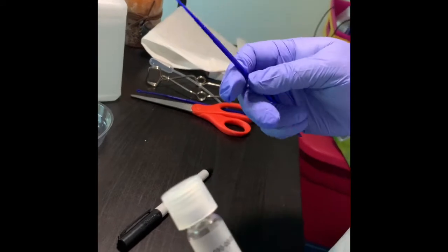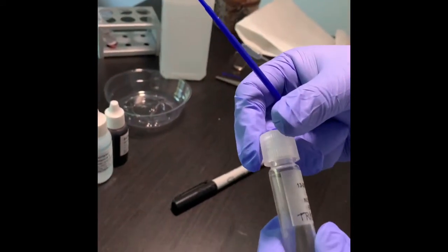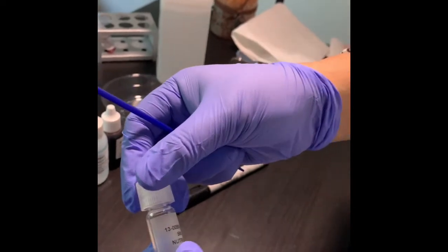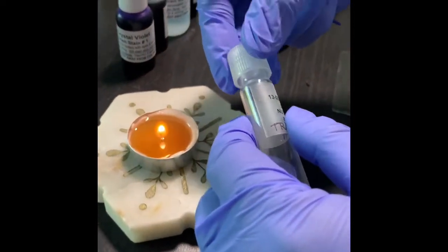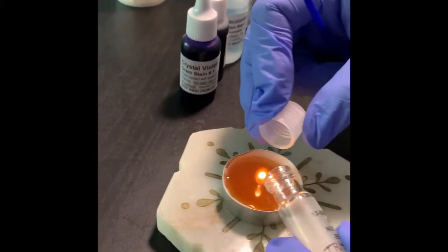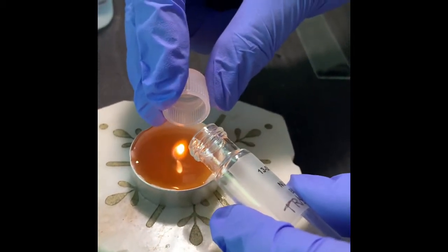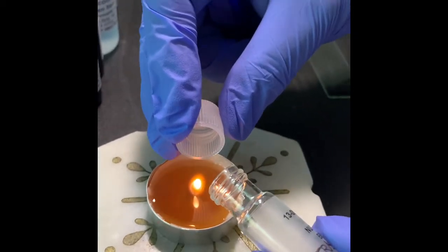Okay, so this is aseptic technique. That means I have to apply my aseptic technique to take the culture because I want to keep the culture for future use. So what is that? Watch it carefully. I'm opening the mouth of the tube in front of the flame and creating a convection current so that no microbe from outside can go inside or any microbe from inside can come outside.